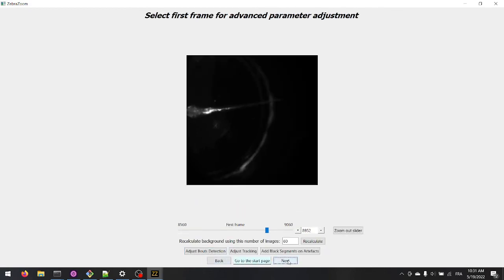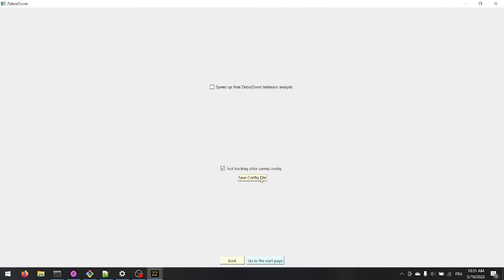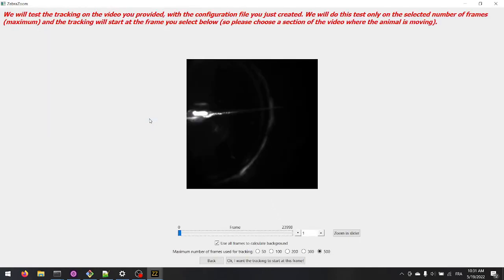The configuration file is now done. Make sure to save it. In order to check that this configuration file works well for this video, launch the tracking on a subsection of the video with this configuration file.